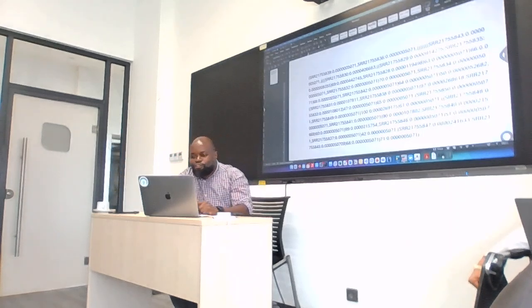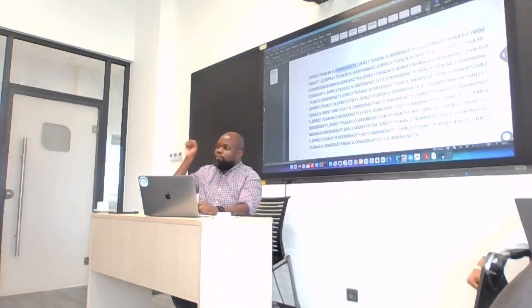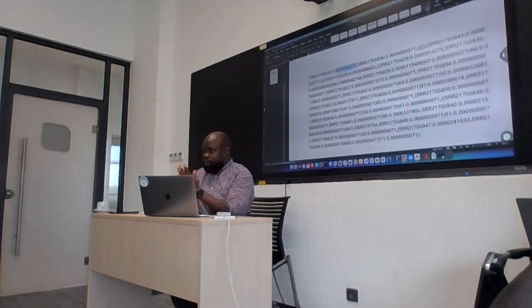Yes. So you can see we have the names of the different tips, and we also have a number after a colon, right? And this refers to the genetic distances that we talked about. So this is how a NEWICK file looks like.